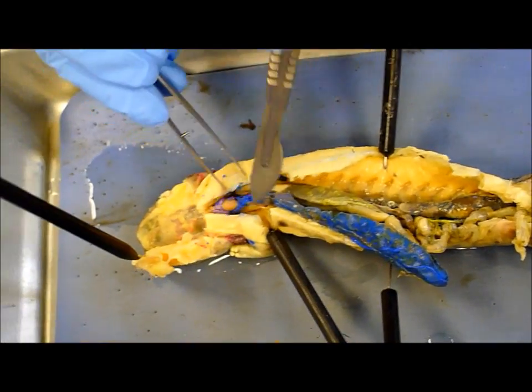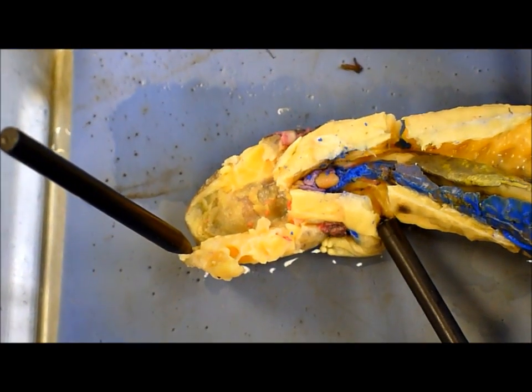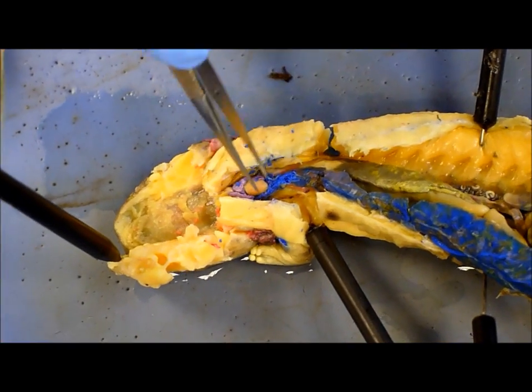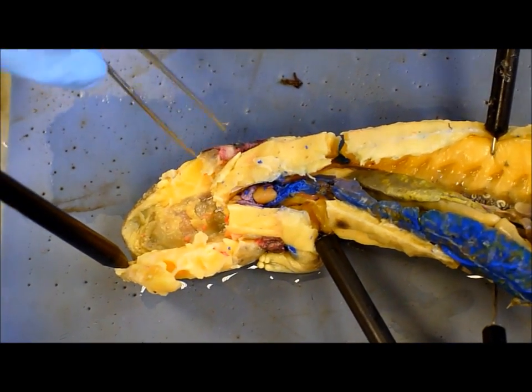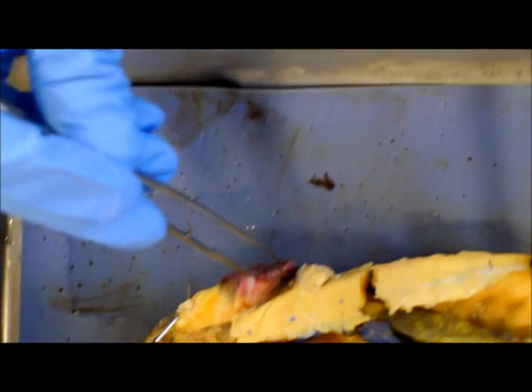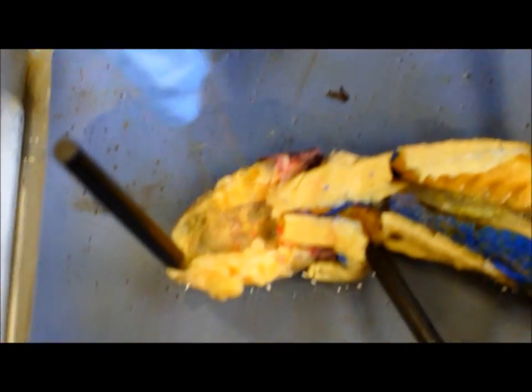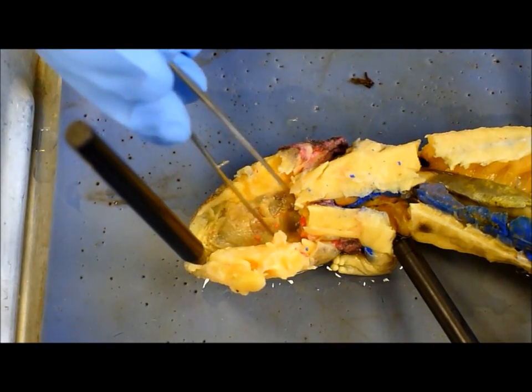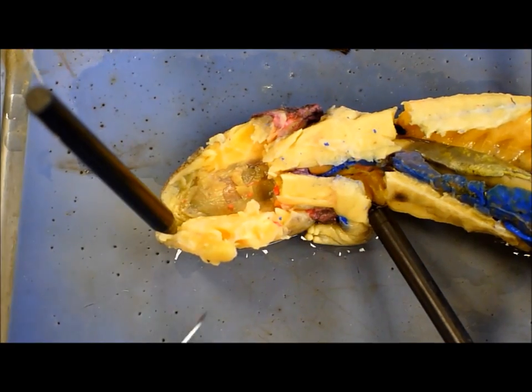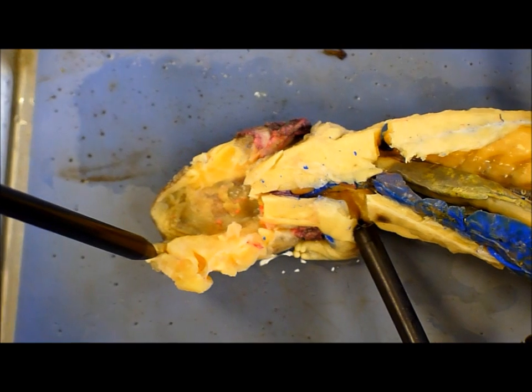Pericardial cavity with the parietal pericardium and visceral pericardium. The heart. The transverse septum, which we cut through — it would be right here. External gills — that — and the gill slits are inside. Oral cavity. Pharynx, put it down in there. Esophagus again. Then the tongue and the glottis — we don't know where the glottis is.